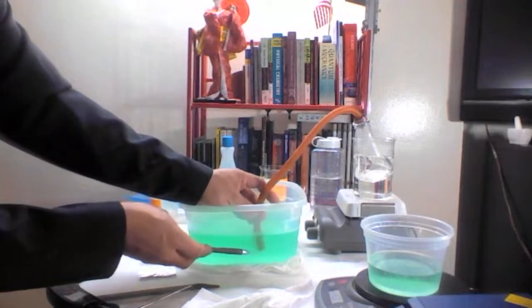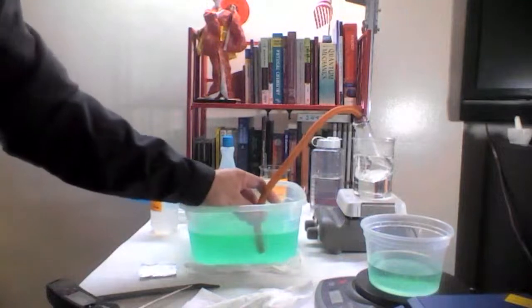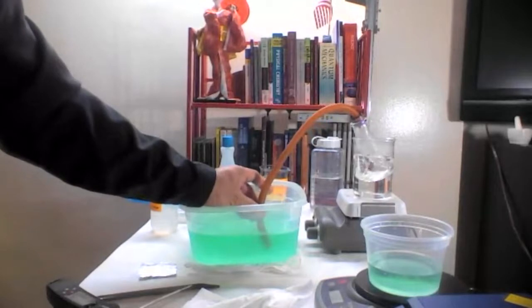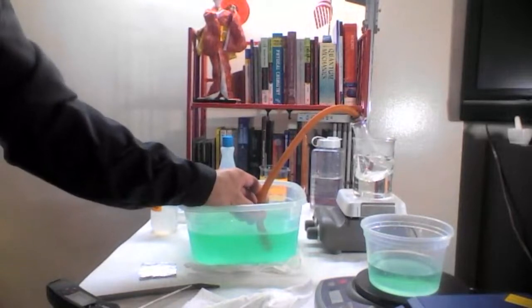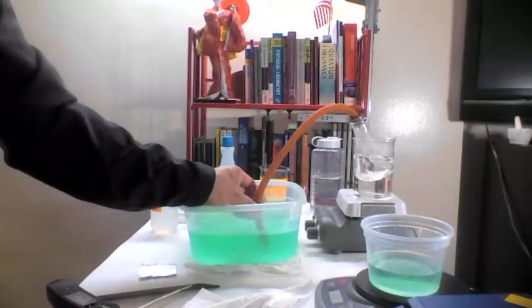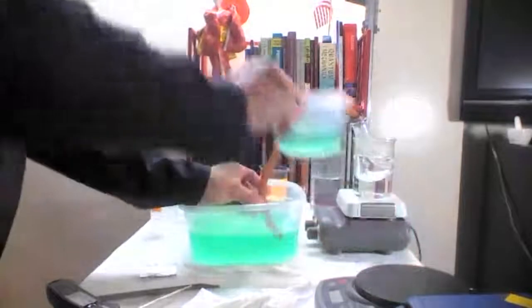As you can see there is bubbling in there. Those bubbles are coming out through there because the 157.5 milliliters of air that we put in there are expanding. Now they do not fit into the 157.5 milliliter volume. The excess volume has to get out, and the way it gets out is by bubbling out through the tube.